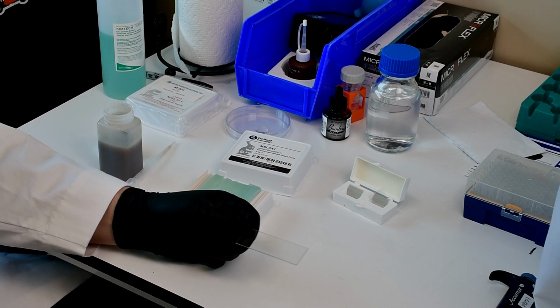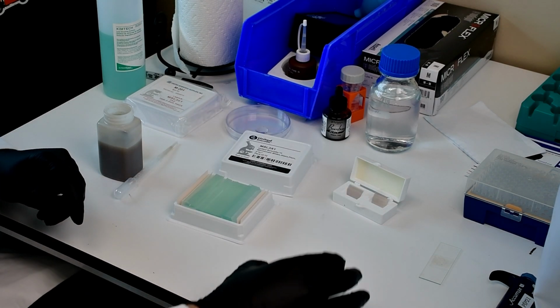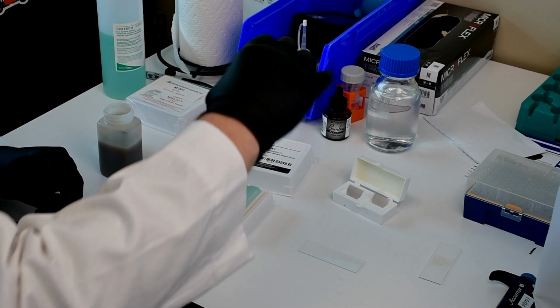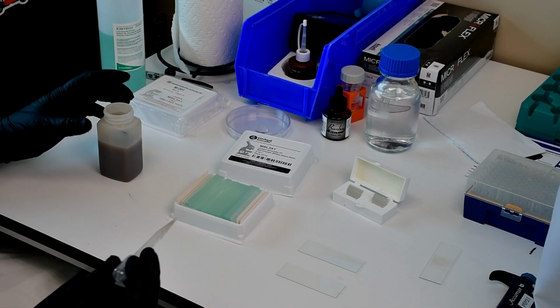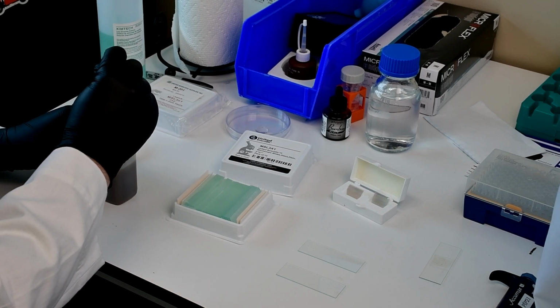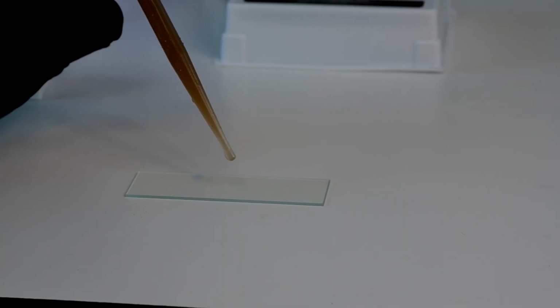What we'll also prepare is a smear. So this is going to be what we're going to use for staining, and I'll prepare 2 of these. So I'm going to do something very similar. I'm going to take a small drop of my mixed liquor sample. I'm going to put a little drop on each, just a very small amount.